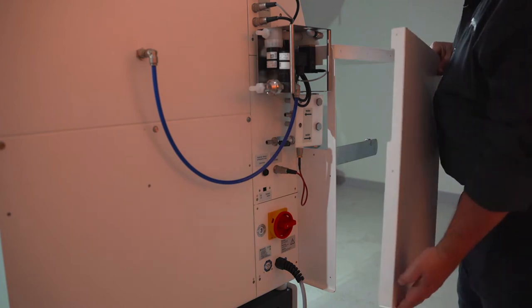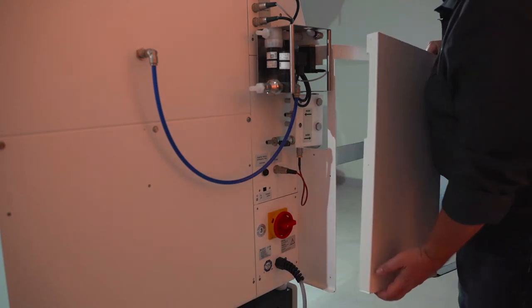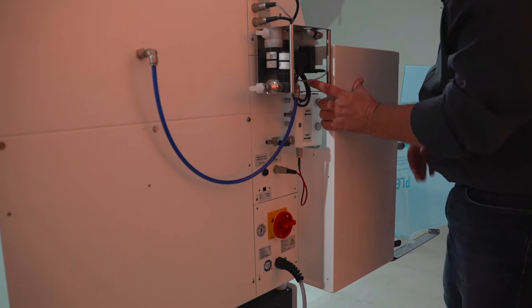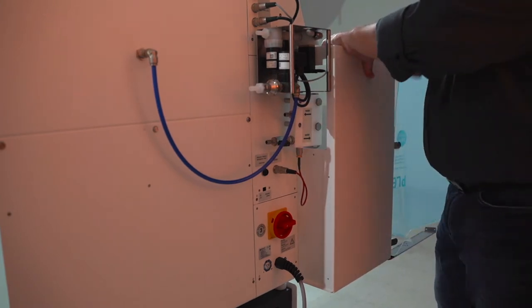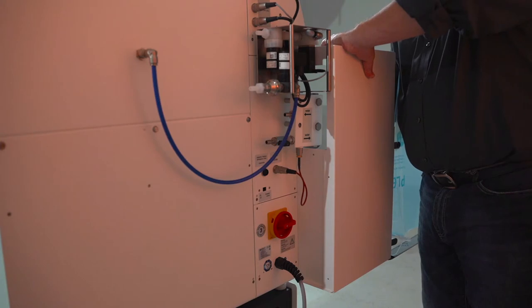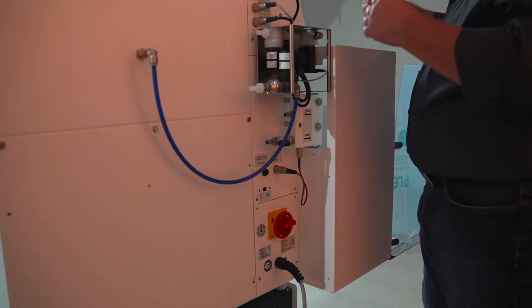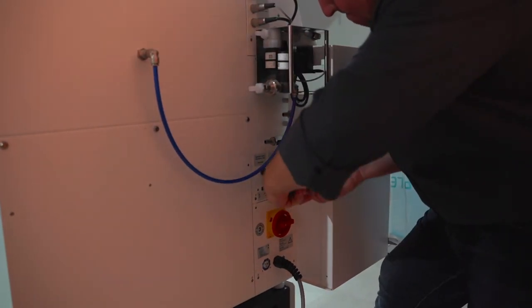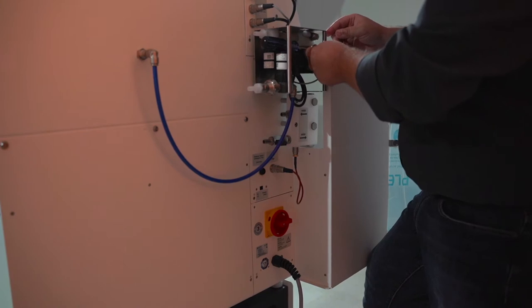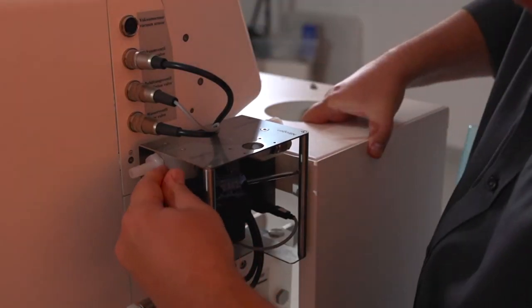Once you remove the three screws on this back panel, you're going to want to take your back cabinet panel. You'll notice that there's a little slot down here — it rides right on the lip of this back panel. So line that up, get that in place. Line your screws on the top for the mantle. Then you'll take your little five millimeter nut and screw that in on the center screw. The top one is always the trickiest because now we're going through three panels, so you want to make sure you get all the holes properly aligned to get that screw caught.